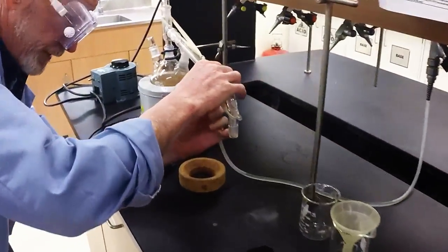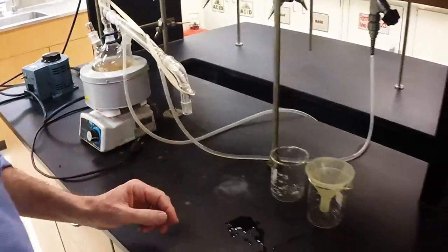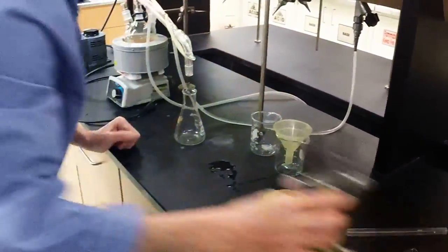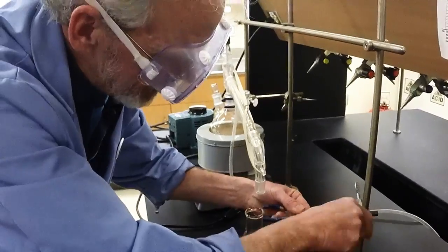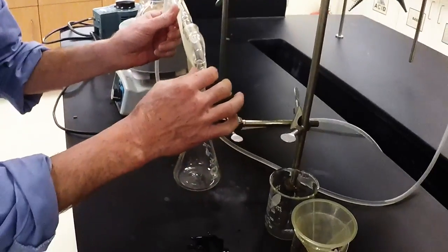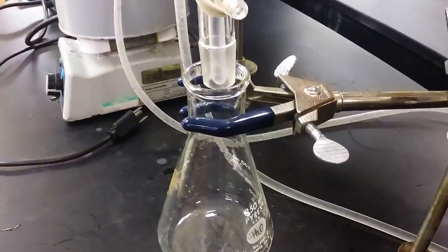Cold water in the bottom and out the top and into the sink. We will collect our product in this 250 milliliter flask. It's always good to clamp these flasks — it's so easy to just bump it and knock it over. So position your clamp, get it secure, and raise it up until your distillate will fall into there.